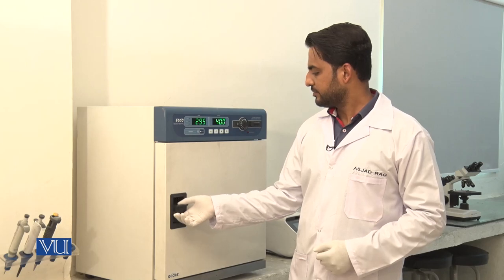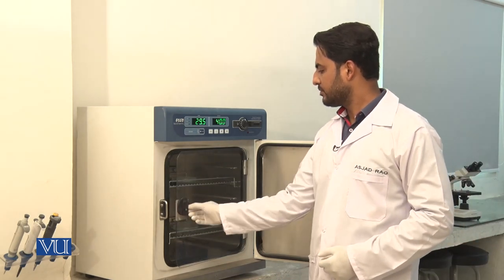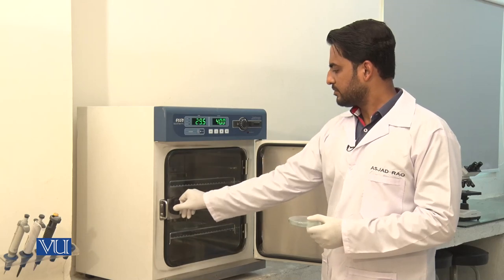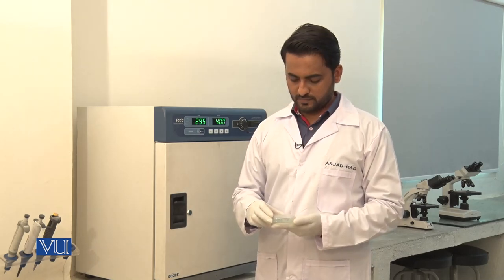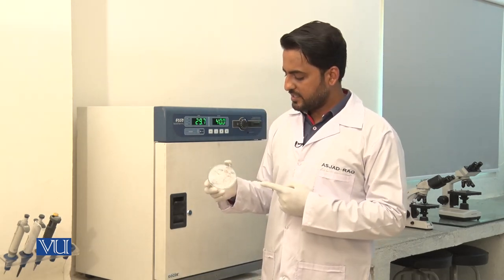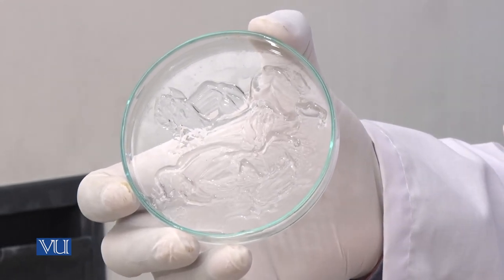The incubation time has been over, so now we will take our Petri plates out of the incubator and observe the results. Take out the lid of the Petri plate. Students, you can see a transparent gel-like material, which is our extracted lipids. This is how you can extract lipids from a food source.